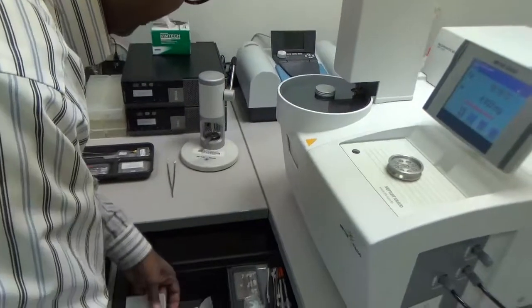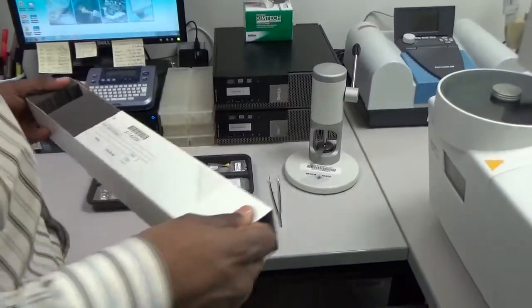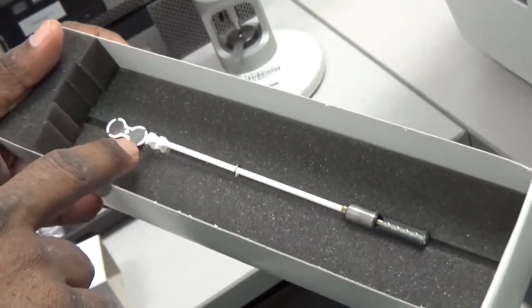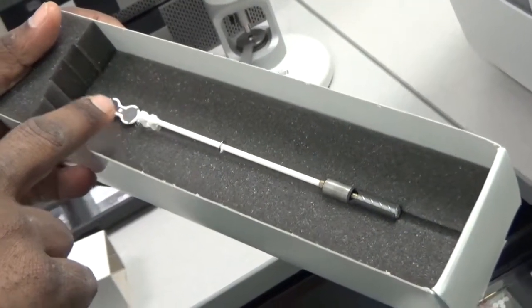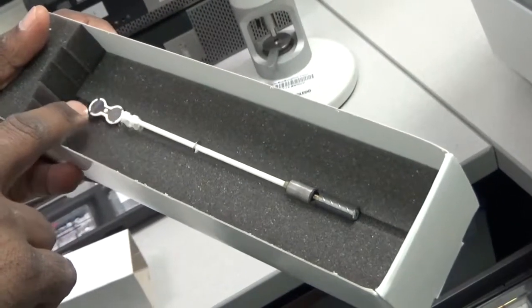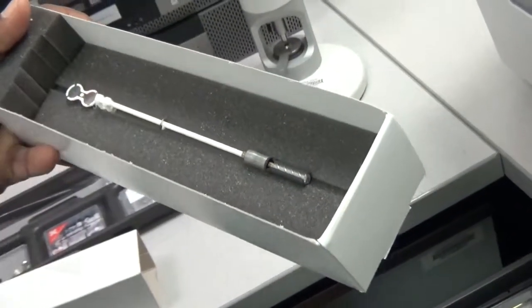Here are the sensors I was talking about. We have TGA DTA sensors, which are currently used in the unit. This is the TGA DTA sensor, which has a platinum support, and there are two positions — one for the reference crucible and one for the crucible with the sample. We put an empty reference alumina crucible there at all times, and then add the sample crucible in the other position. It determines the differential heat energy absorbed between the reference and sample crucible for DSC purposes.